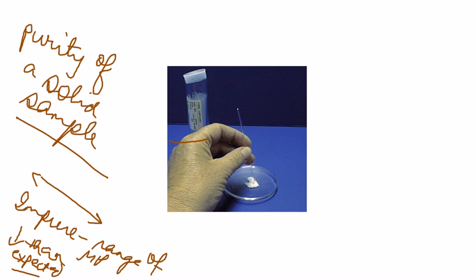Essentially, provided you're taking all the precautions necessary for that experiment, you can expect a lower melting point, again depending on the amount of impurity, as low as 10 to 20 degrees or as little as about 2 to 5 degrees. So you have to keep an eye on the literature value and report what you got.